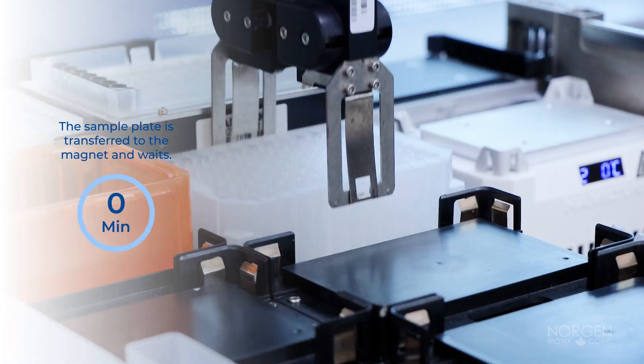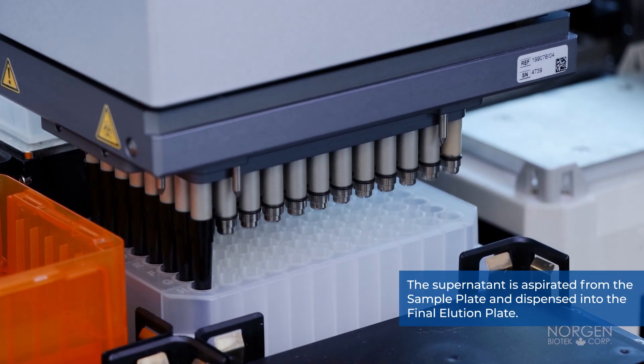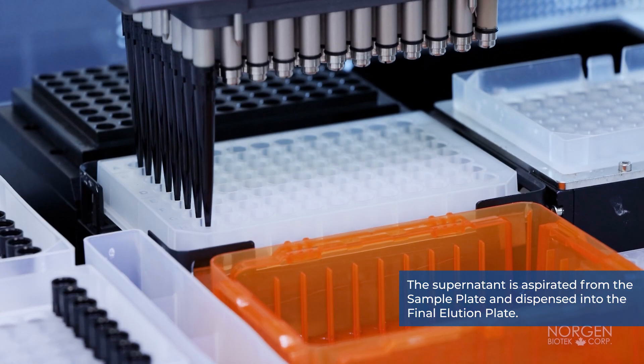The sample plate is placed onto the magnet for 2 minutes. The supernatant is aspirated from the sample plate and dispensed into the final elution plate.